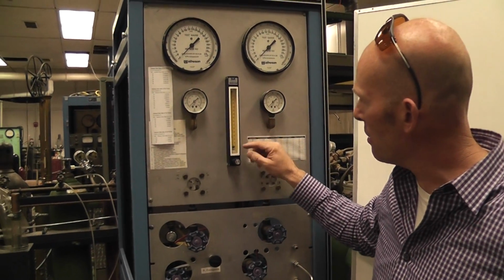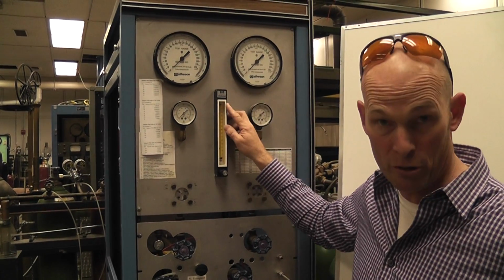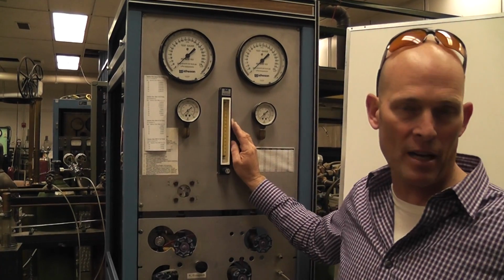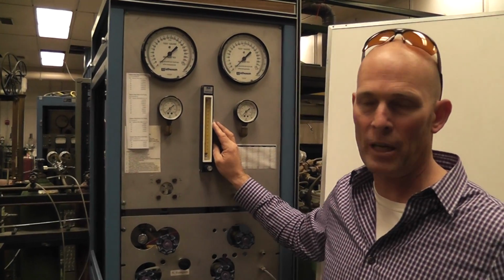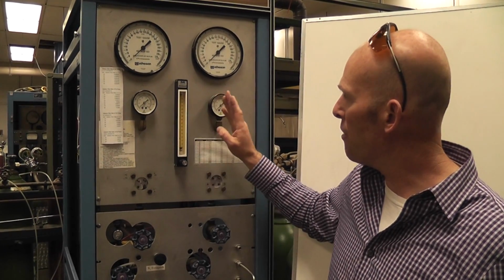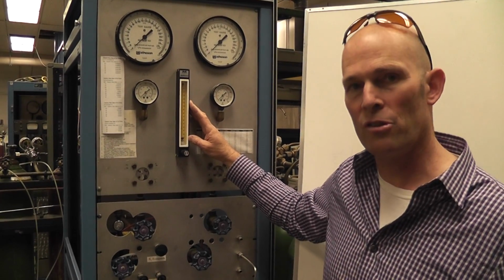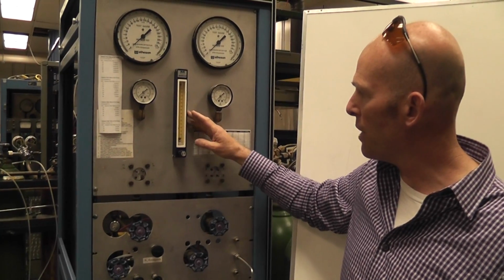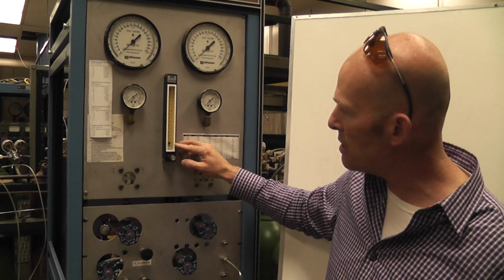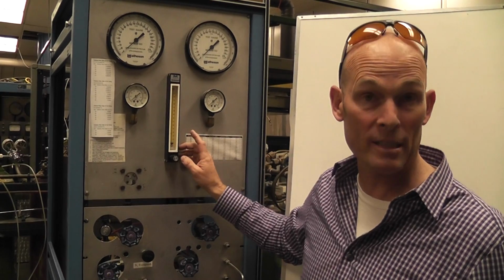What you see here is a glass tube, and the tube is a Matheson tube. That's who manufactures it. And this one is a 605, and a 605 will handle a number of different gases, but air, nitrogen, and oxygen, I think, are typically flowed through this. The tube itself can handle 2 different ranges of flow rates, and those 2 ranges are represented by the 2 different balls that are inside the tube. One is steel, and one is a plastic or glass of some kind. So one is heavy and one is light.